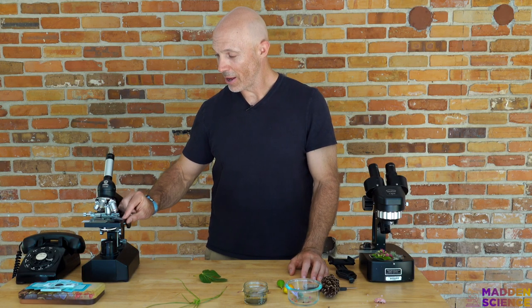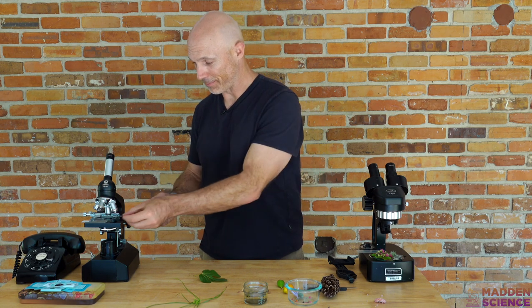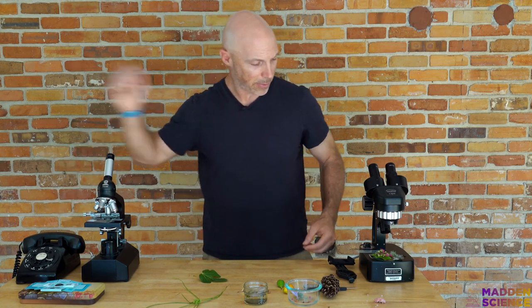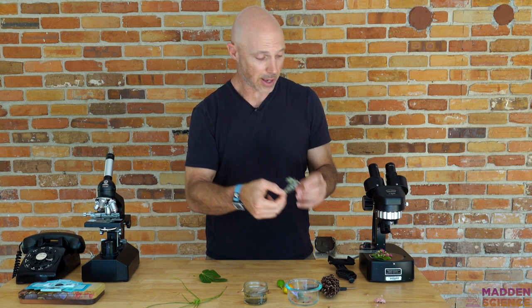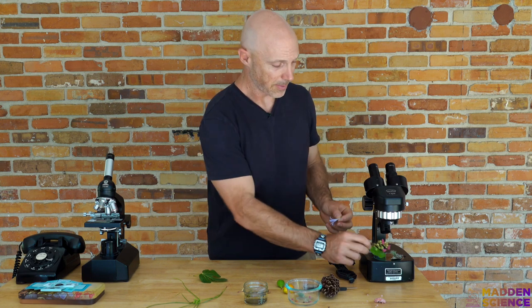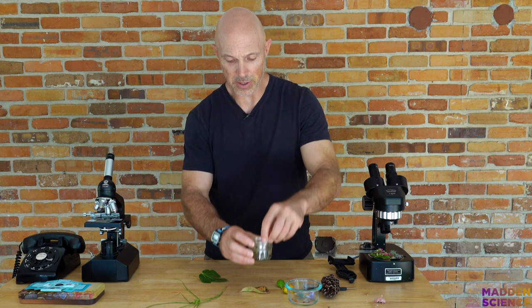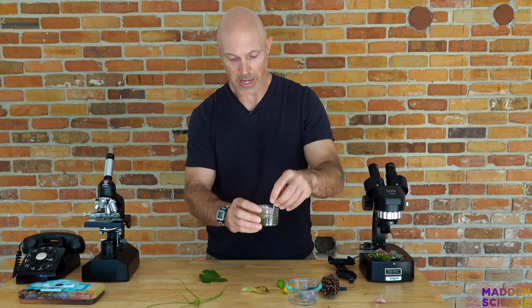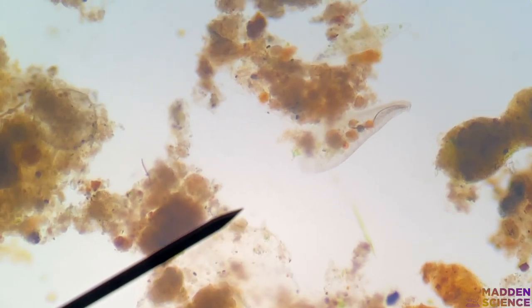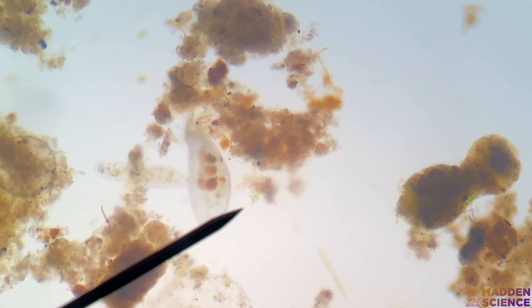I pulled out the microscopes and one of the last things I looked at was a tick that was on my leg. You can use prepared slides like so. You can gather up bark with lichens on it, pretty flowers of all shapes and sizes. And probably the coolest thing you can get would be some pond or lake water — something with some muck in it. Take a little pipette; you can see all sorts of stuff inside. This can be looked at primarily with a wet mount slide using a light optical microscope.